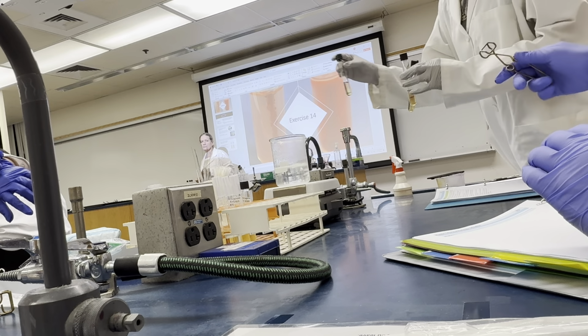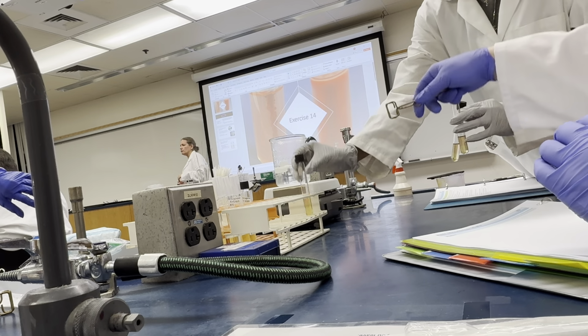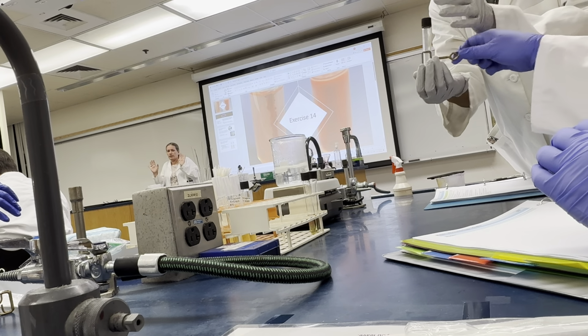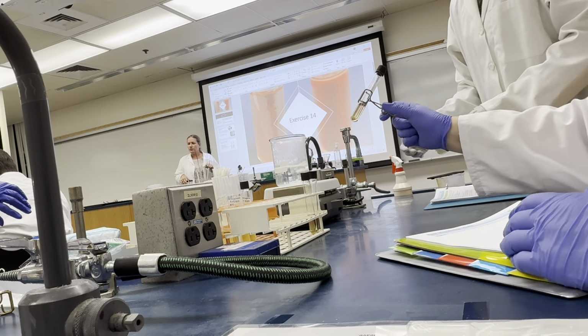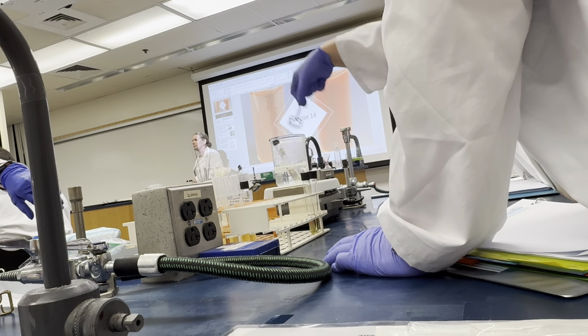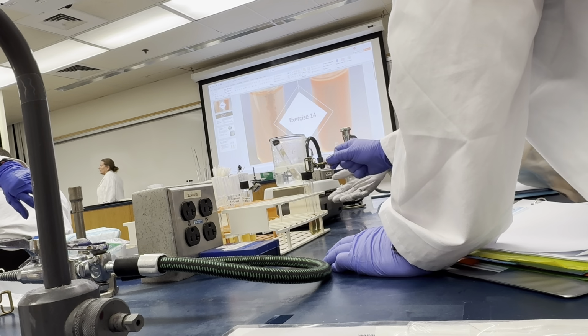So it's 5 minutes, right? Yeah, just put it in. If it goes a little more than 5 minutes, it's not going to be an issue, okay? Like I said, I don't want our water to boil off. That's the only thing we need the water for, to heat it up. Once that time is up, we'll take them out and let them cool, so they'll be cool by the time you're ready to use them. All right.